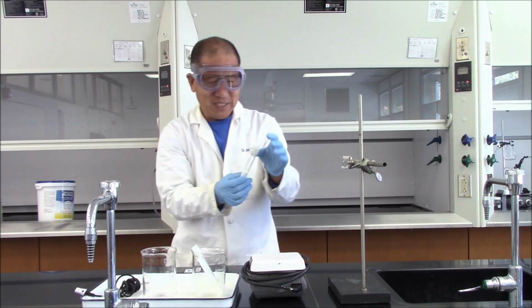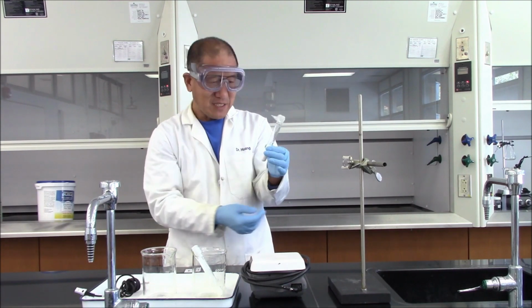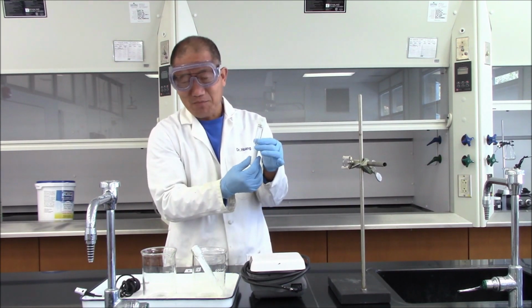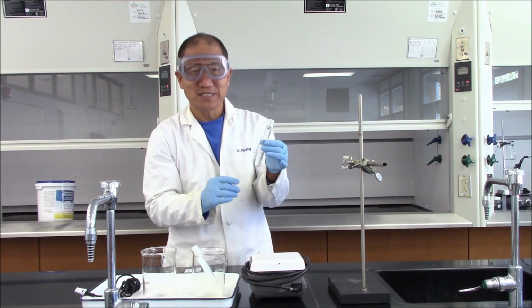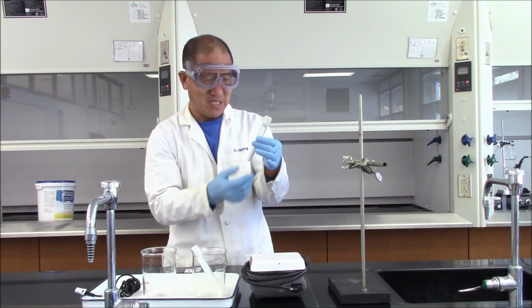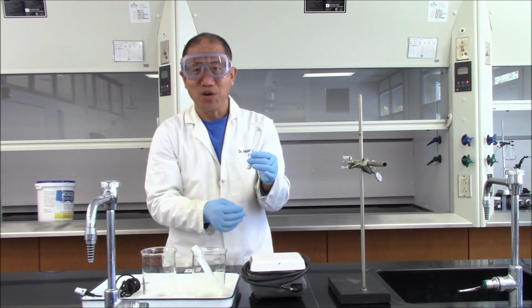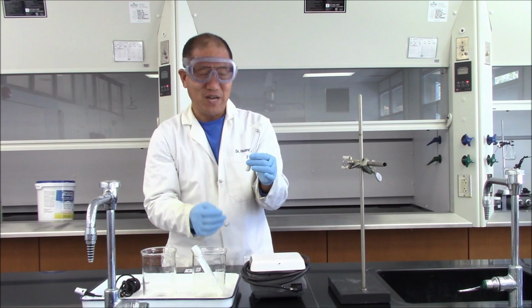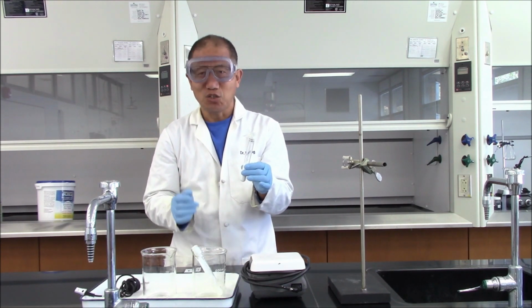The other one is a benzoic acid lauric acid mixture. The lab manager, Carla, told me that the mass of the benzoic acid is 1.000 grams. The mass of the lauric acid is 8.000 grams. Make sure you put the numbers in the notebook.